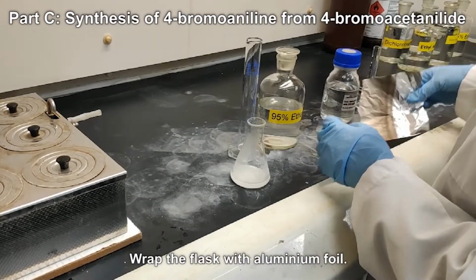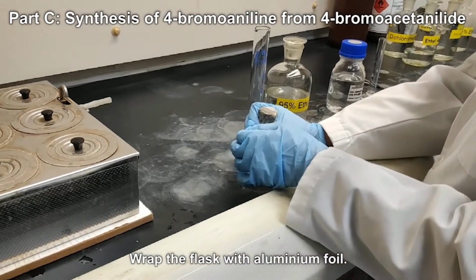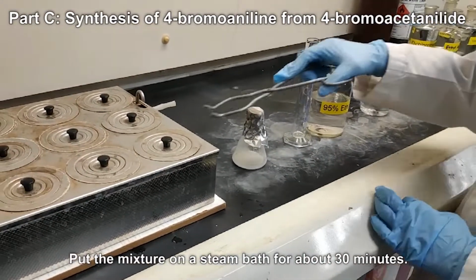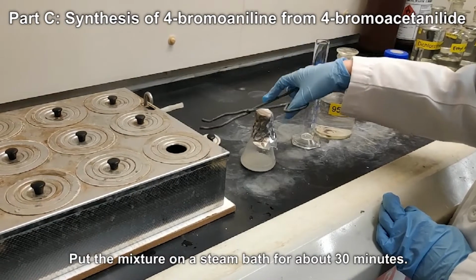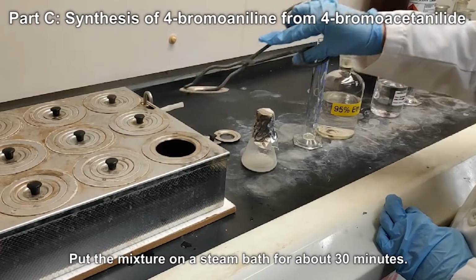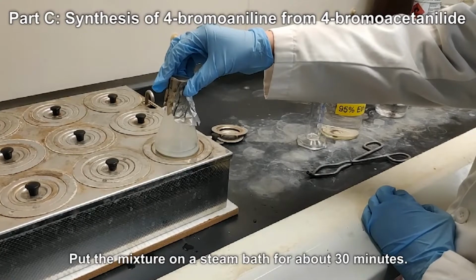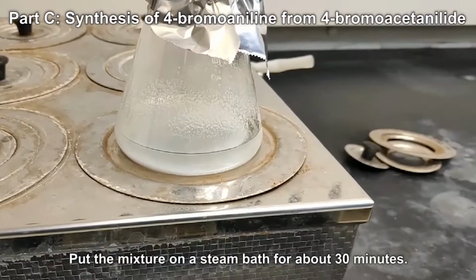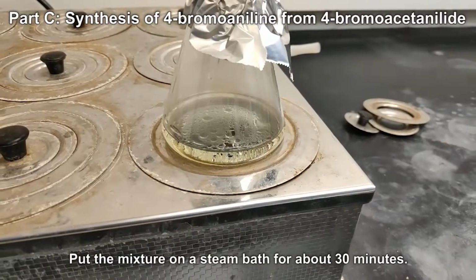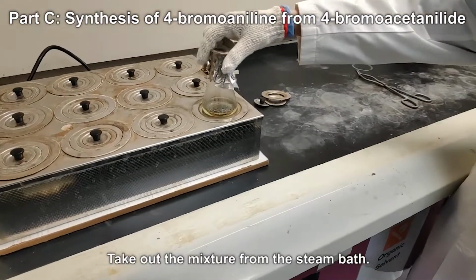Wrap the flask with aluminum foil. Put the mixture on a steam bath for about 30 minutes. Take out the mixture from the steam bath.